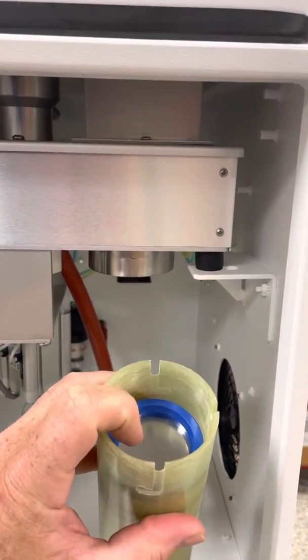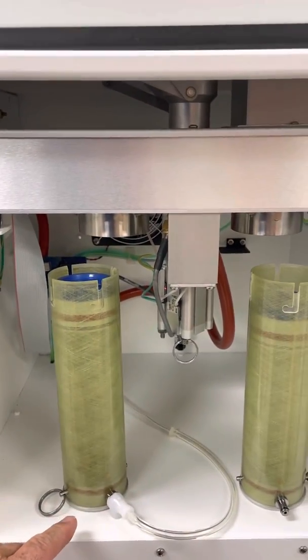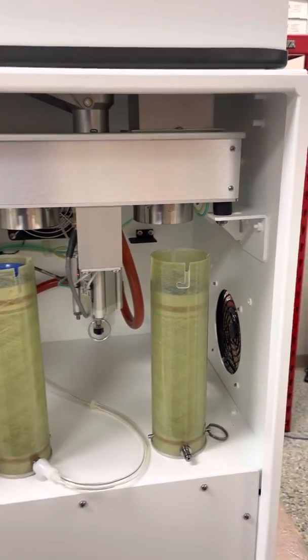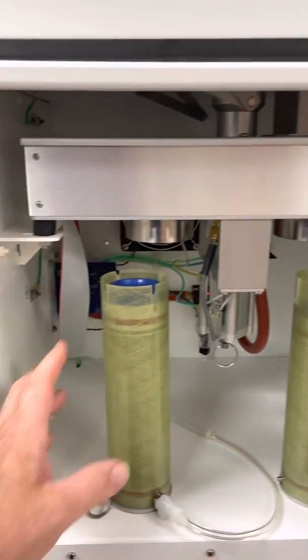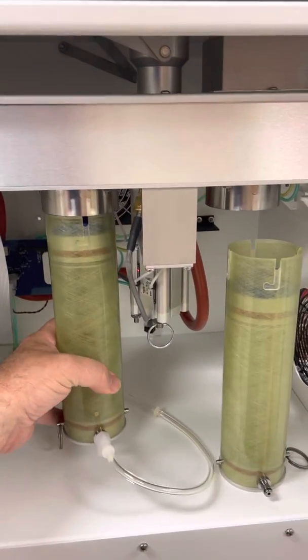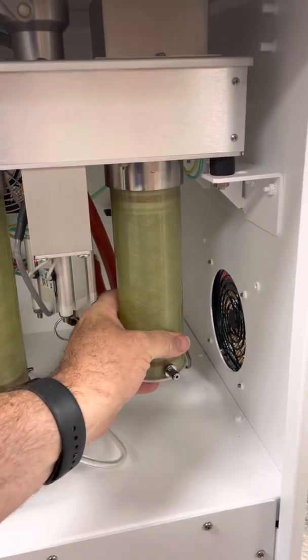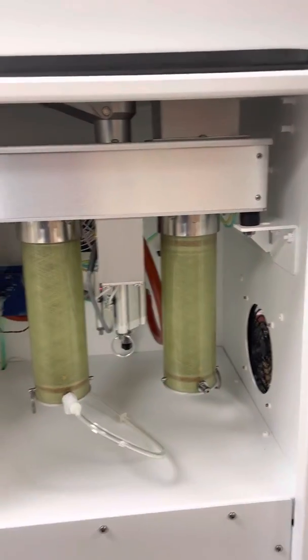It will drop down in here. After all 16 cassettes have been pushed up and sampled, they'll be dropped into this collector cylinder. After 16 samples, the operator can come out, simply remove the cylinder, cap it, send it off to the lab, and then load in another fresh 16 cassettes — just push up, turn and lock — and load in an empty cylinder to collect the 16 cassettes as they each move up, over, sample, and drop into this cylinder.